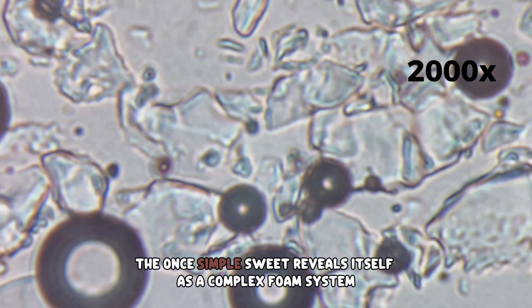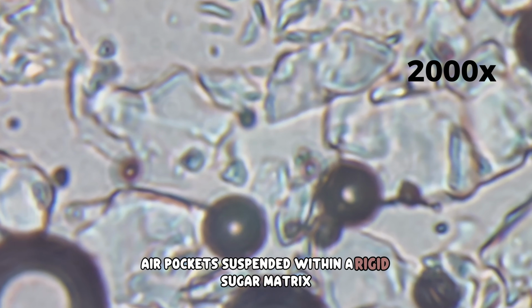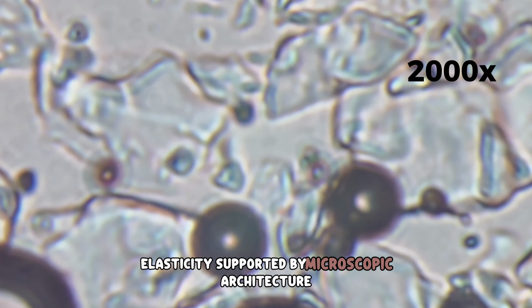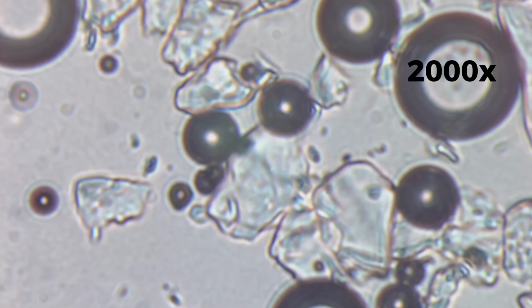The once simple sweet reveals itself as a complex foam system. Air pockets suspended within a rigid sugar matrix. Elasticity supported by microscopic architecture. Nothing here resembles the soft candy we hold in our hands.